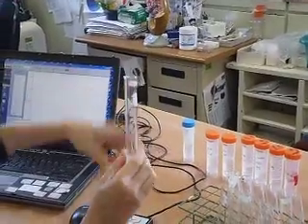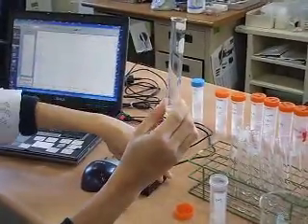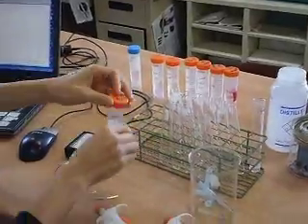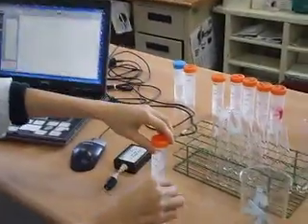And how are we going to measure? We're going to use a gas pressure sensor. The change of pressure over time will represent the rate of reaction. So this is done. We're going to run two experiments, starting out with 0.5 M of hydrochloric acid.